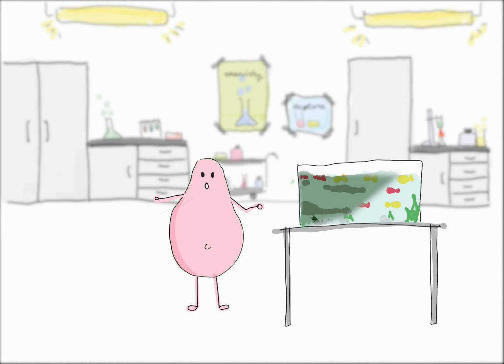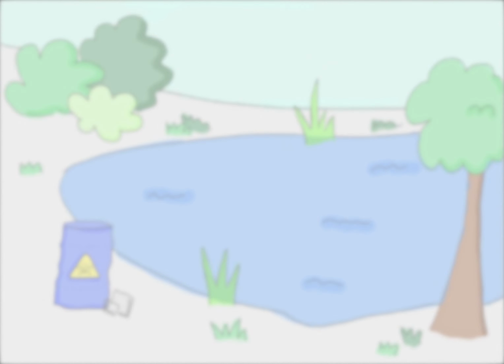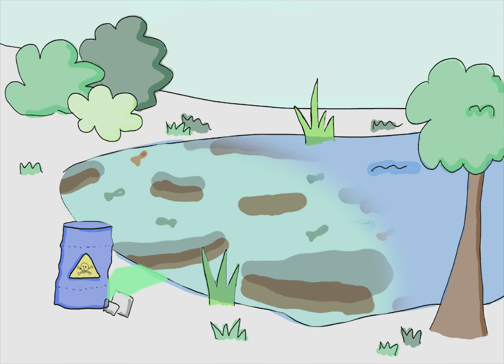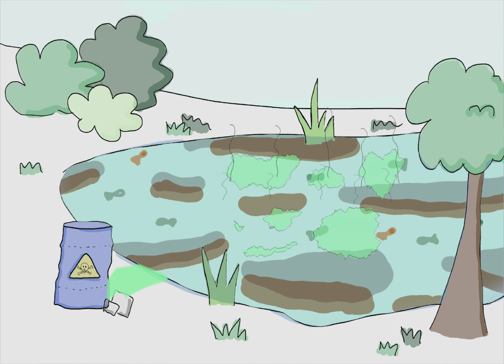Well, I wouldn't pour any chemicals into my aquarium either. Oh wait! What if some of the incorrectly disposed chemicals get into a lake or creek? This would then also harm the animals. Okay, I didn't think about that before.